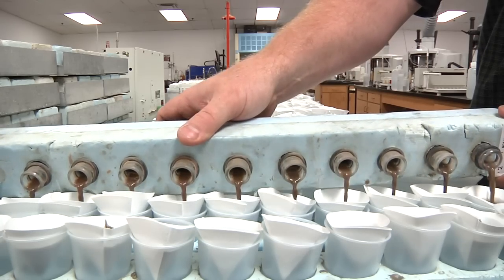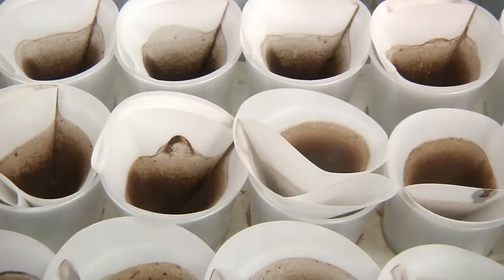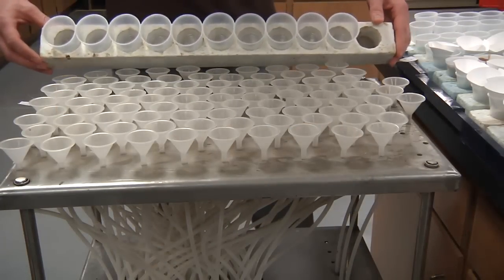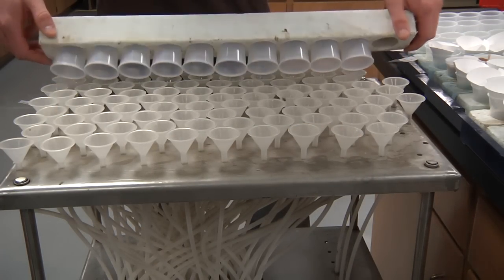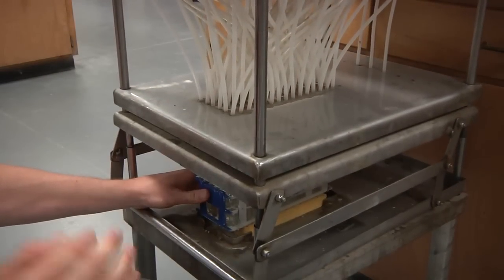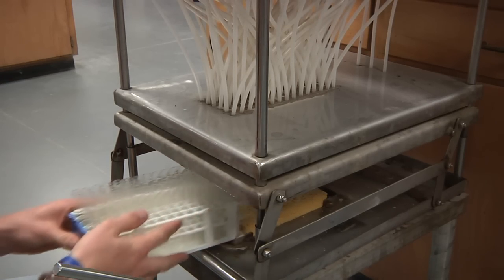The extractant is then filtered through filter paper into plastic cups. The filtrate is transferred to test tubes in autosampler racks. The racks are placed on autosamplers.